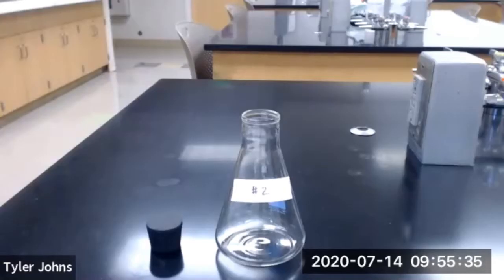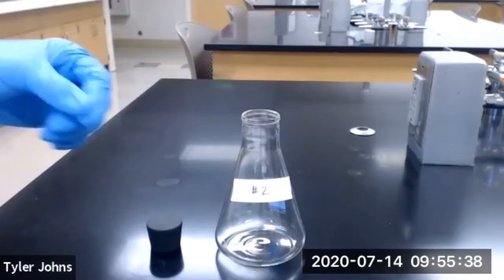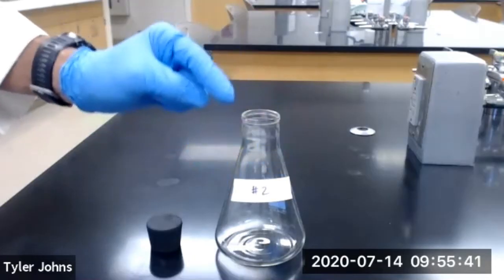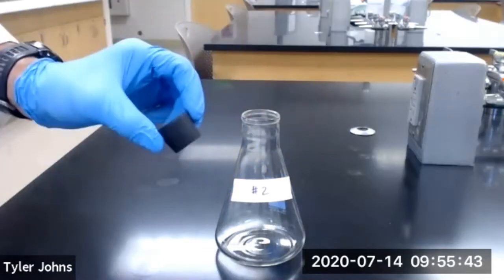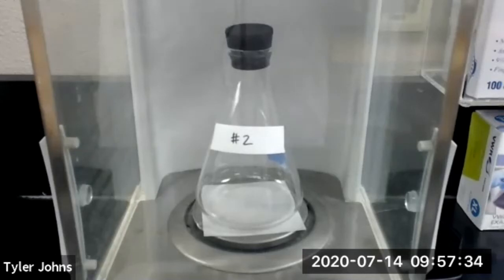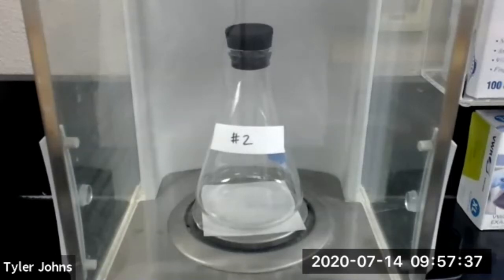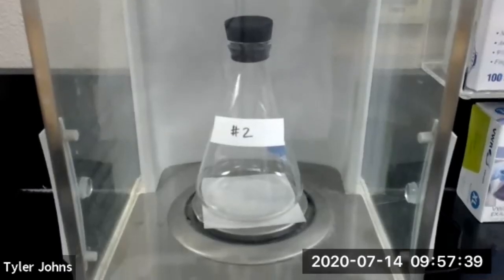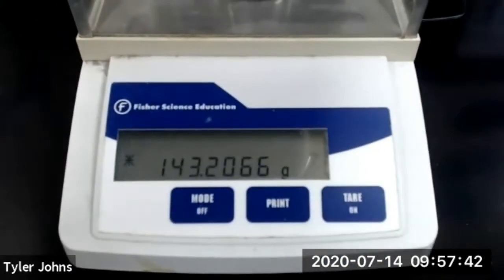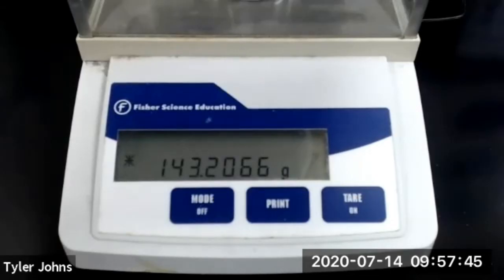We next need to repeat the procedure for trial number two. We'll determine the mass of our Erlenmeyer flask, the air inside the flask, and our stopper. The mass of our Erlenmeyer flask, stopper, and air for trial number two is 143.2066 grams.